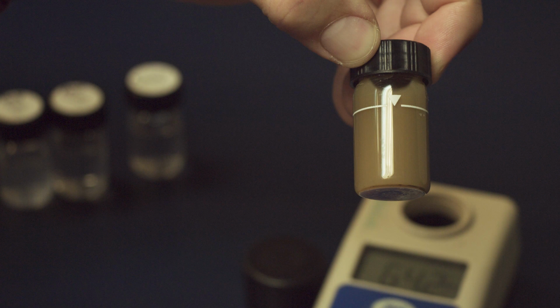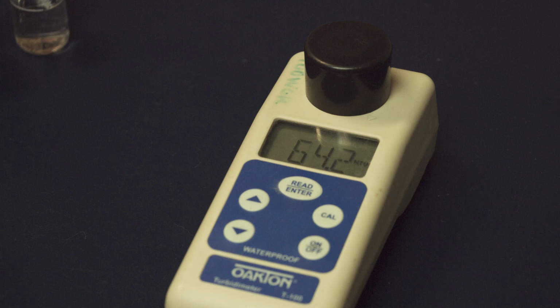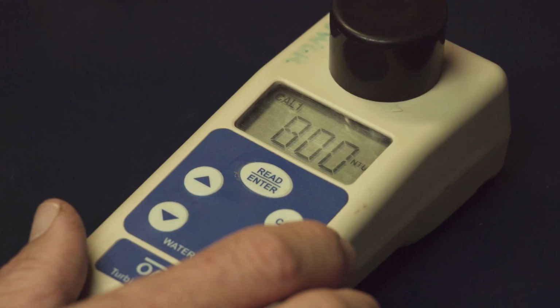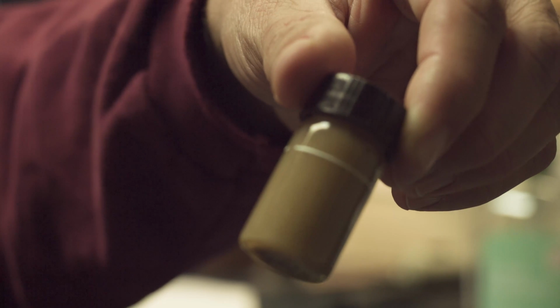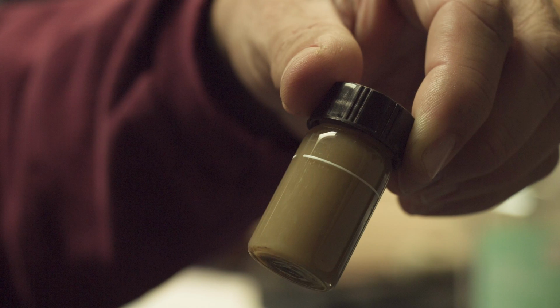During some recent sampling adventures, we've been noticing that some of our high turbidity samples have been getting abnormally low NTU readings on our turbidity meters. Using a calibrated turbidity meter, we conducted a series of experiments using a sample with noticeably high turbidity. I mean, look at that, it's nearly indistinguishable from chocolate milk.